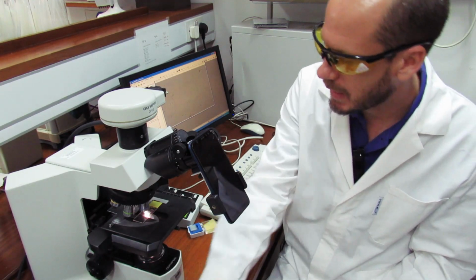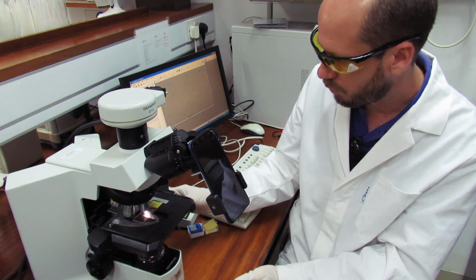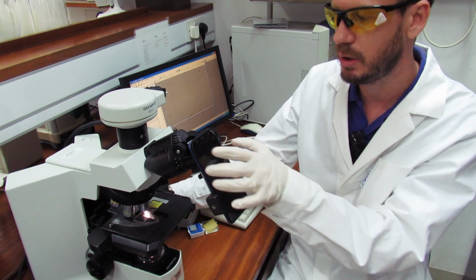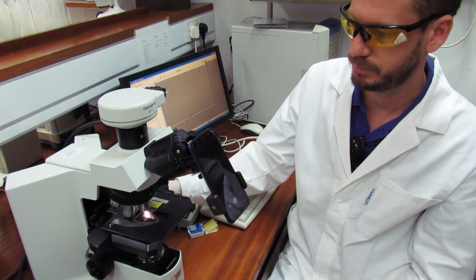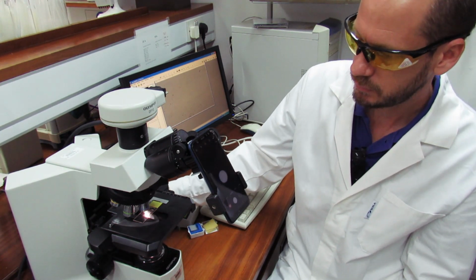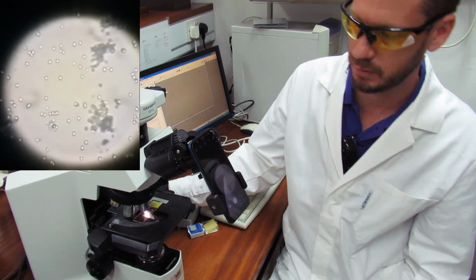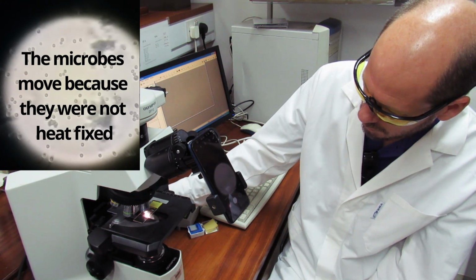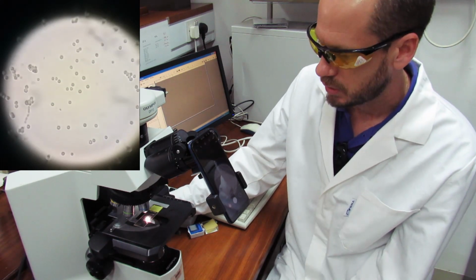So we place the slide here on our stage, and we are going to go through the whole process of focusing. But I'm going to show you using the camera on our cell phone. So you can see here on the cell phone, there is the focusing. I will start by lowering the stage a little bit more.